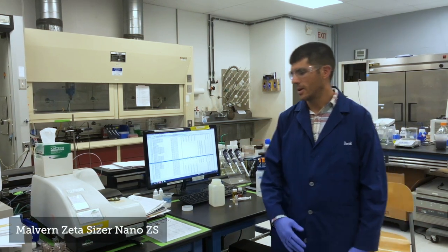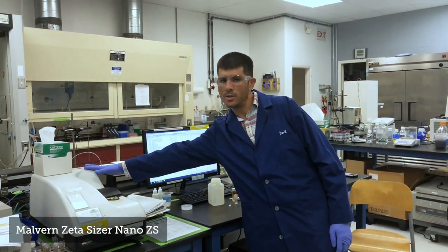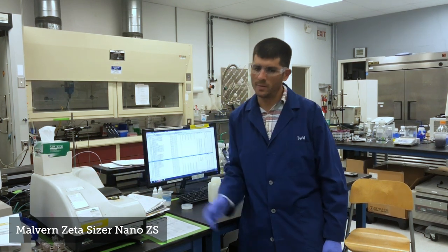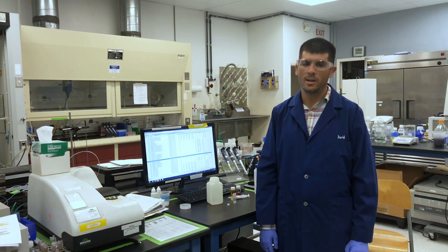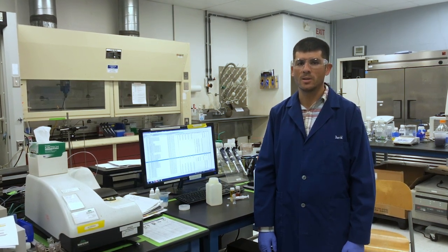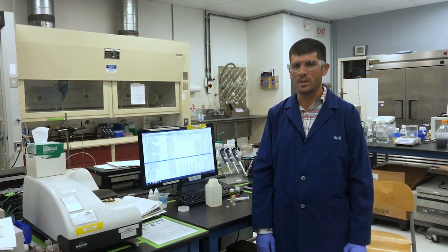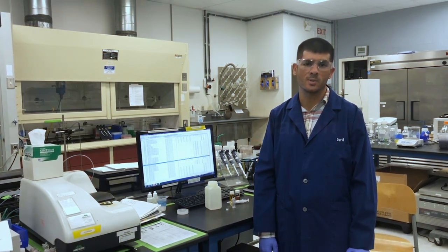Our talk today is going to be centered around a Malvern Zetasizer Nano ZS instrument, which is a very popular choice in both industry and academic labs. Instruments from other manufacturers operate on similar principles and should follow fairly similar procedures for testing as well.